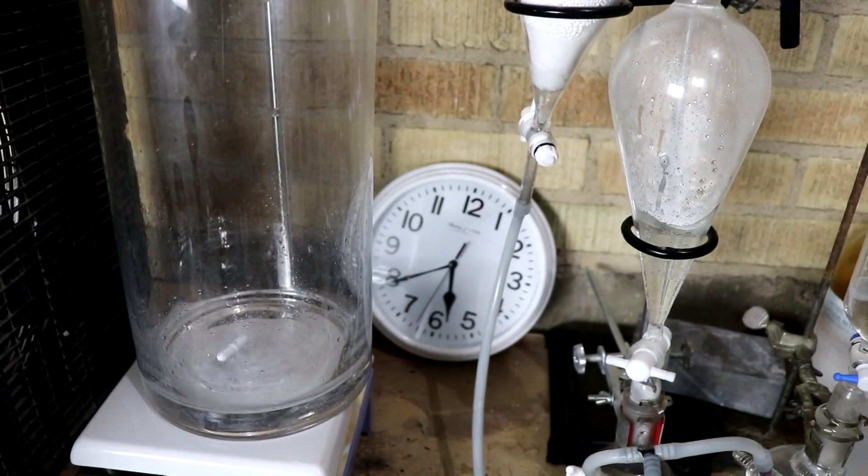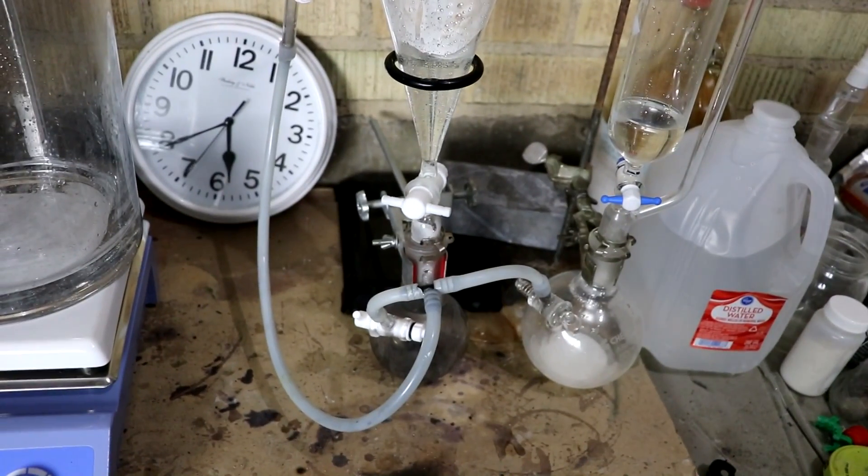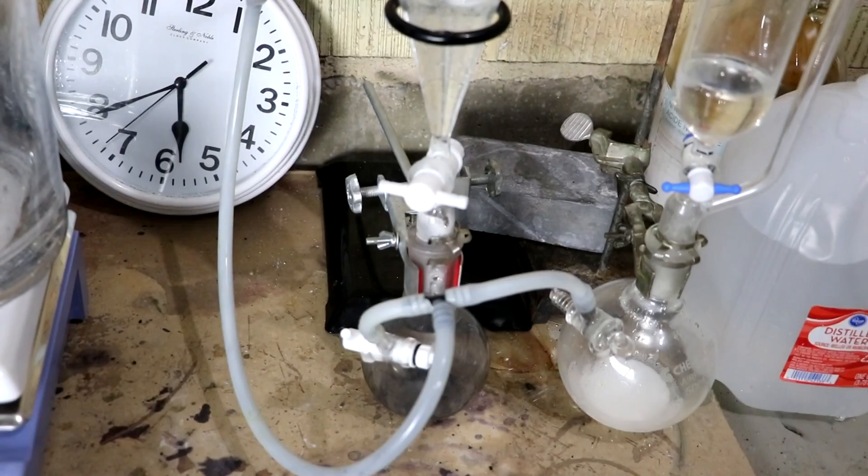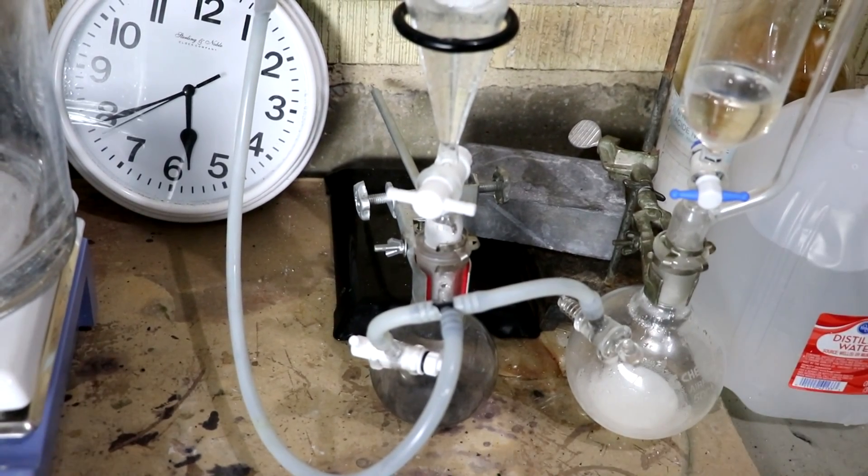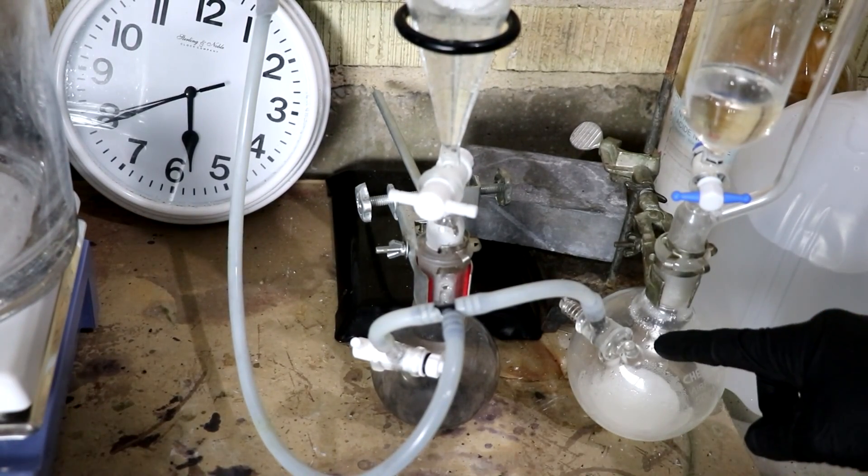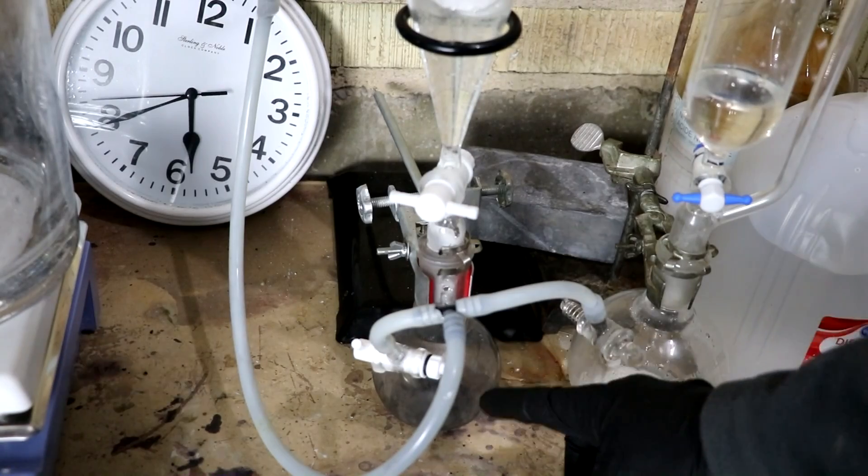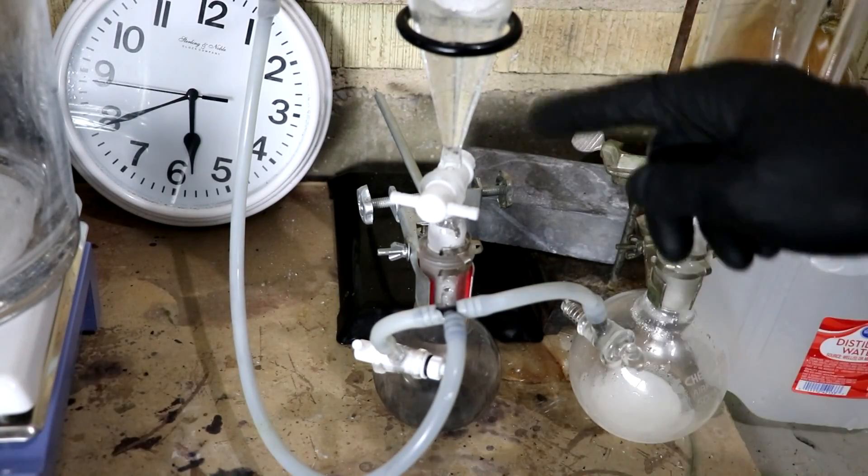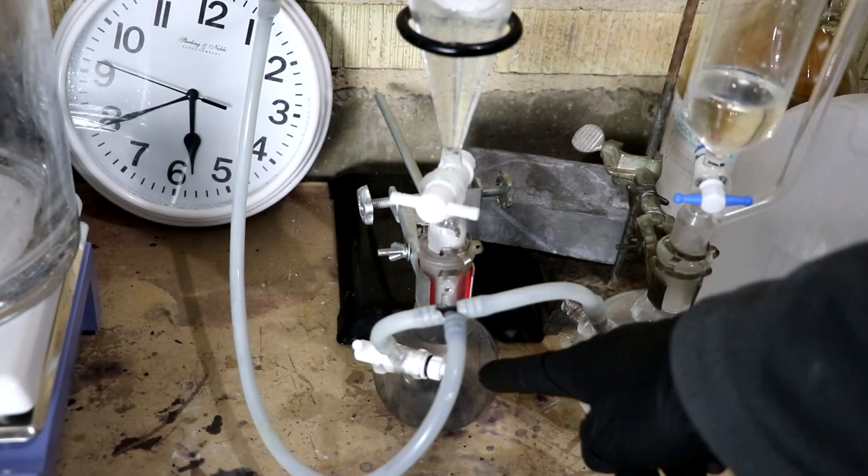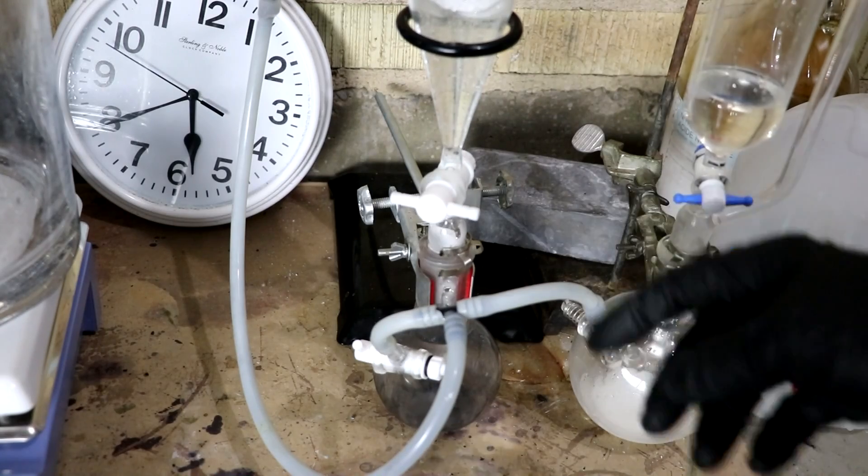It's time to replace the atmosphere with my own mixture. For that I'm going to use a pair of gas generators here. This one will be making sulfur dioxide and this one will be making oxygen gas.